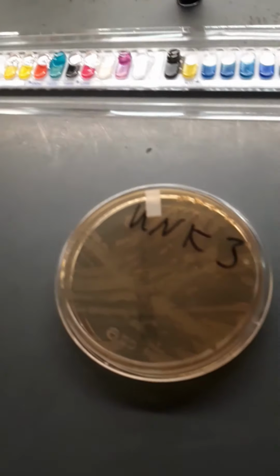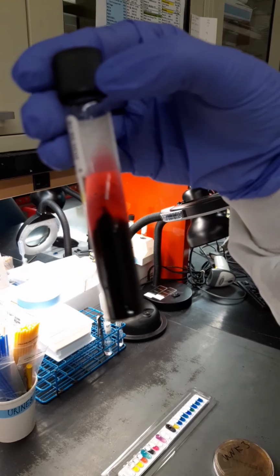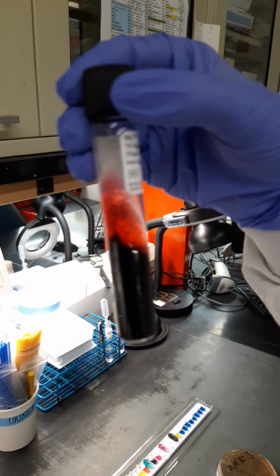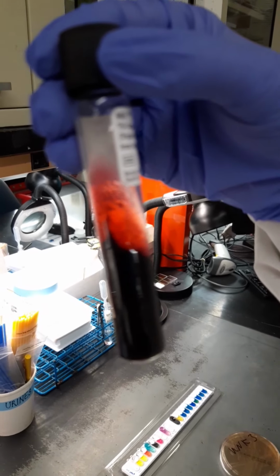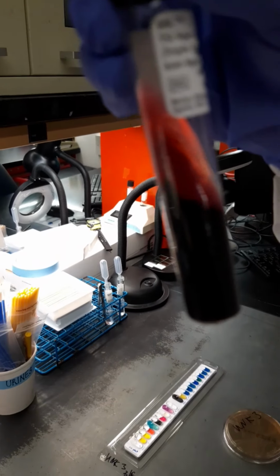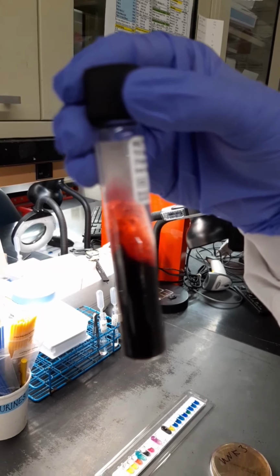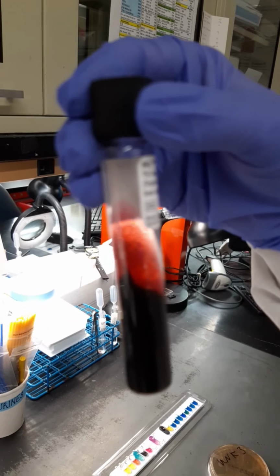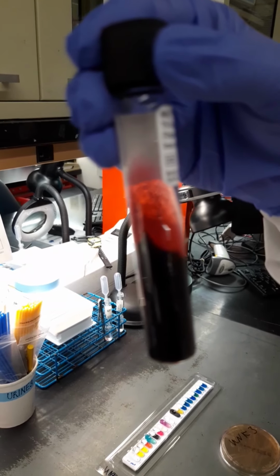Now we're going to move on to unknown 3. Again, non-lactose fermenting. And now we're going to look at this TSI. And this TSI is black on the bottom. You can't see about the glucose underneath because the black is covering over it. But I will tell you, it is a glucose fermenter because it is an enteric. It's K on the top because, again, the lactose and sucrose did not ferment, so it's not yellow. And you have the H2S positive because it's black. So we would say K over B for black.